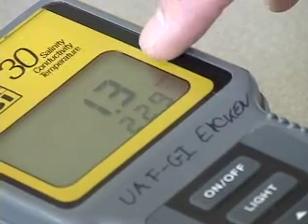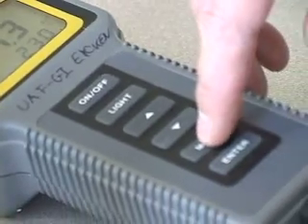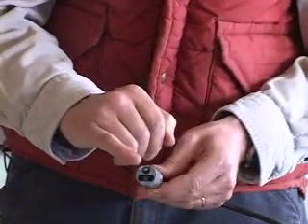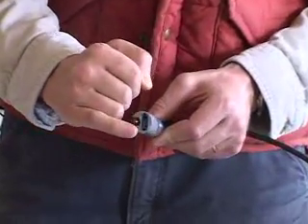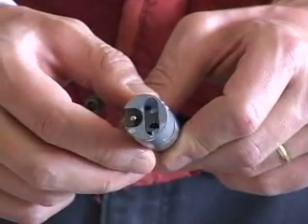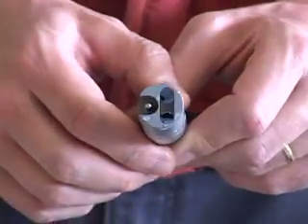Salinity is routinely measured using a conductivity probe or a conductivity temperature probe. This is the one that we're using here. You have the actual display and the actual instrument, and then we have a separate probe that has a little thermometer at the tip to measure the temperature of the water. There's a little opening that leads to a small volume where we have two electrodes pointing into the volume of water to determine the electrolytical conductivity.